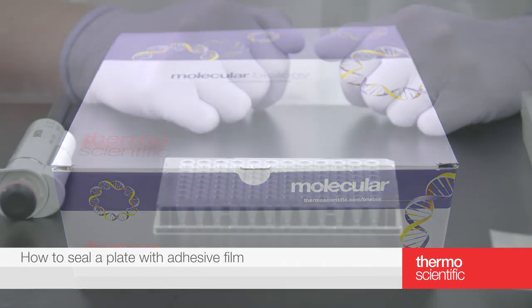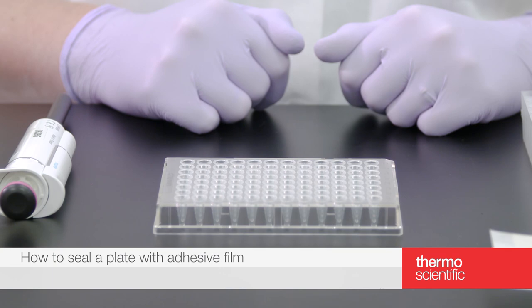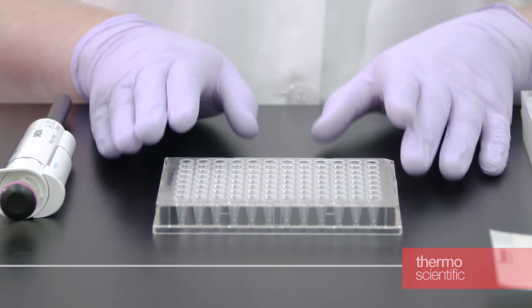To begin, place your PCR reaction plate on a flat surface and add samples to each well.